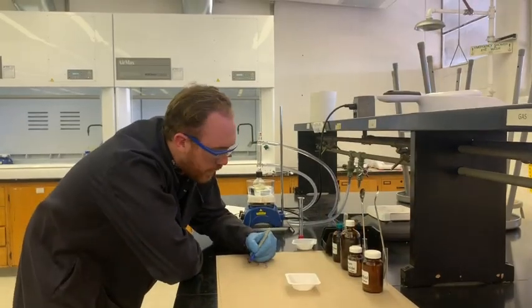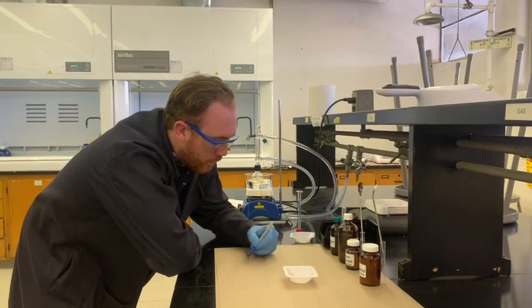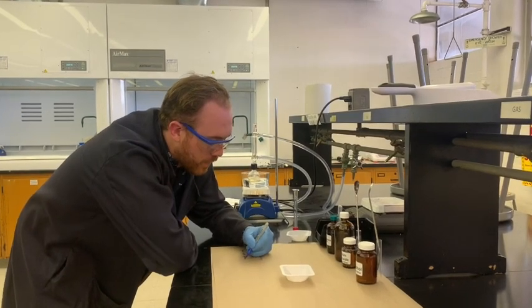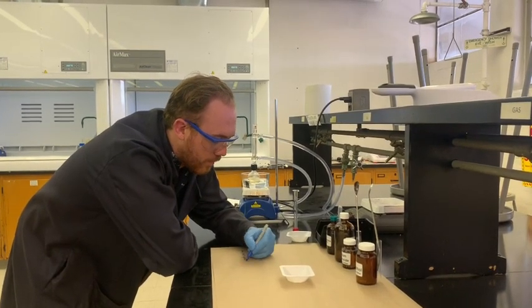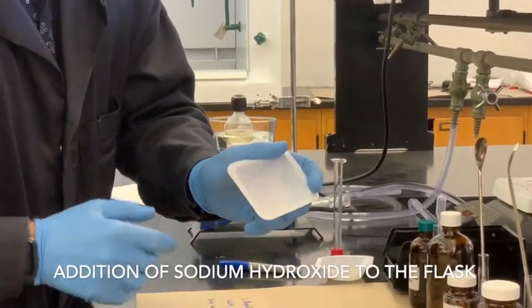The color is a light tan, maybe like a sand color. You can be as descriptive as you want. But you have some NaOH pellets. We're going to add them because everything is fully dissolved in there.